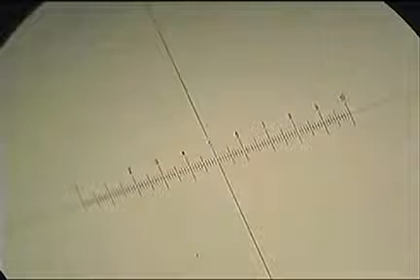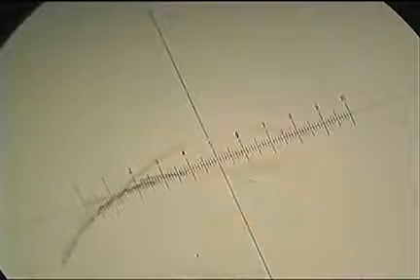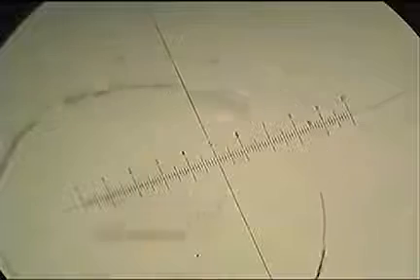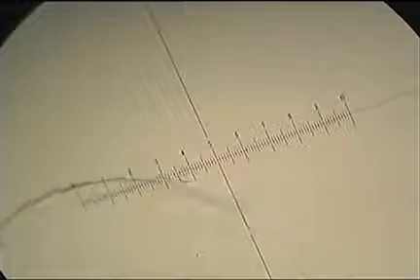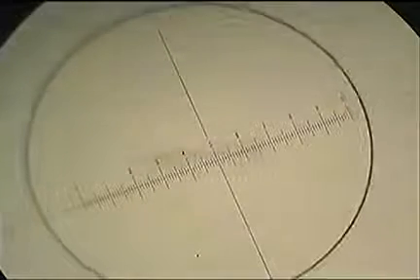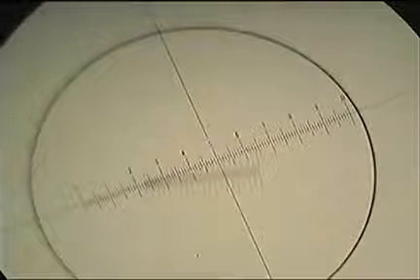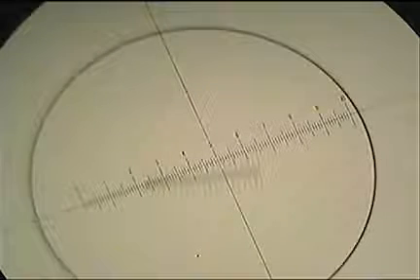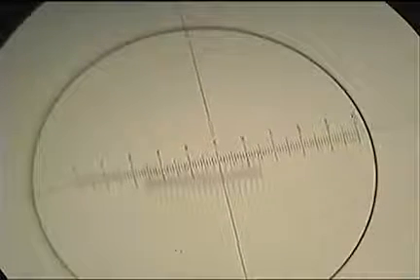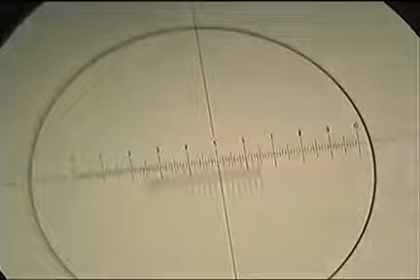So I've put a stage micrometer under the microscope, and I'm just trying to move it around to line it up. So a stage micrometer is a physical slide, a piece of glass, and it basically has a very tiny ruler on it. So we can use this ruler, those are known measurements on there, and if we match them up with our eyepiece graticule, we can figure out what each unit on there actually represents. The one I'm using here is labeled 0.01 millimeters. That's the smallest unit, and at the moment they're quite fuzzy, we can't really make them out.